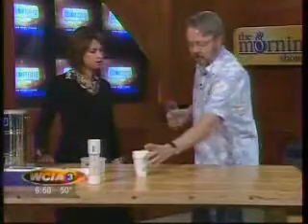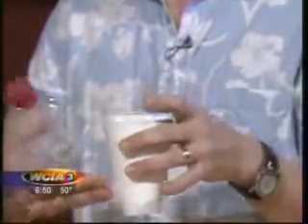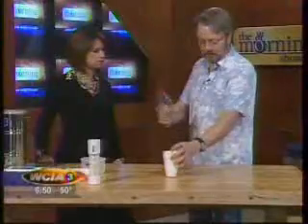So although it takes quite a long time, many seconds, for this stuff to go from being a liquid to being a gas, which takes up much more space than a liquid, the explosion happens very rapidly when the bottle busts. Okay? So here, the actual turning into a gas, a high-pressure gas, happens rather slowly, whereas in the second segment, when we do an ignition where we light something on fire, that happens very rapidly.